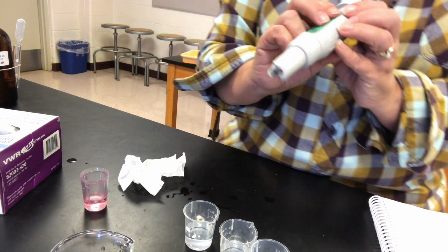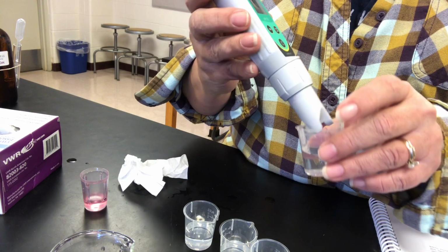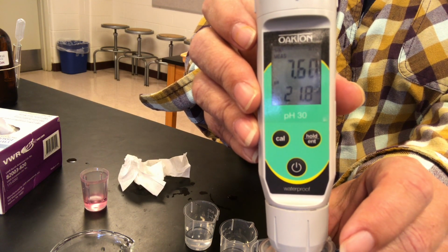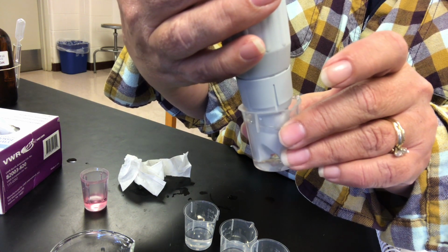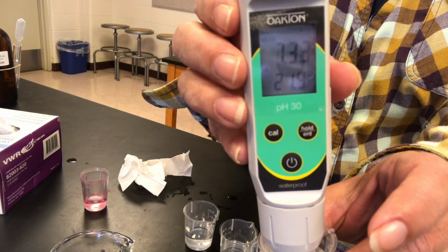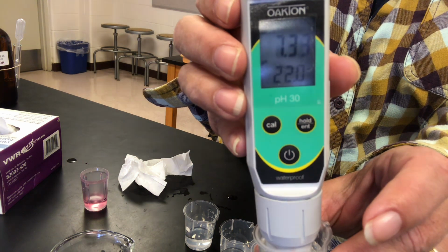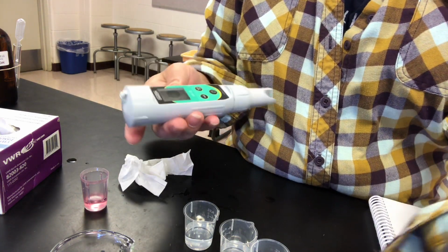Okay, the second solution then is the sodium acetate. So we're looking at the conjugate base of acetic acid. So let's see what its pH value is. And it's looking like not quite stable yet, so hang in there. And you should be able to see it now, fairly stable. If it drifts a little bit, don't sweat it. Just write down a value that looks pretty stable or close to it. And we'll move on to the next substance.